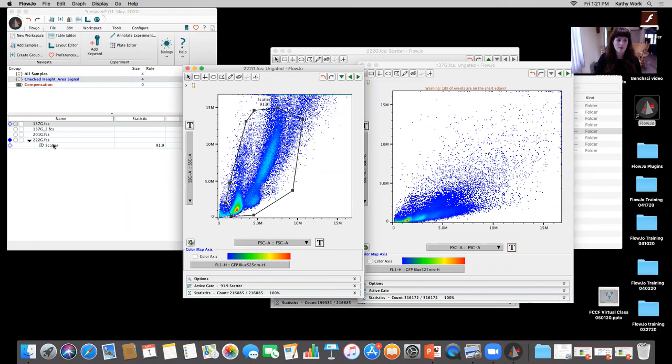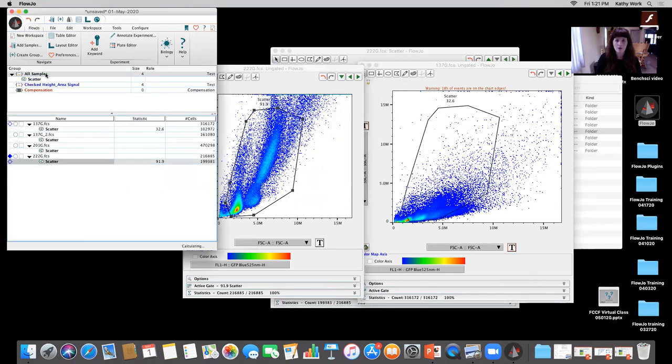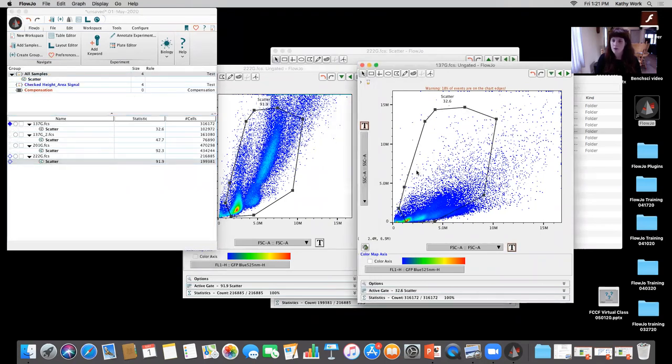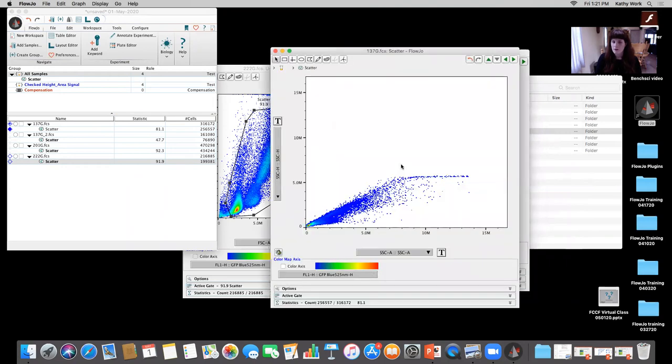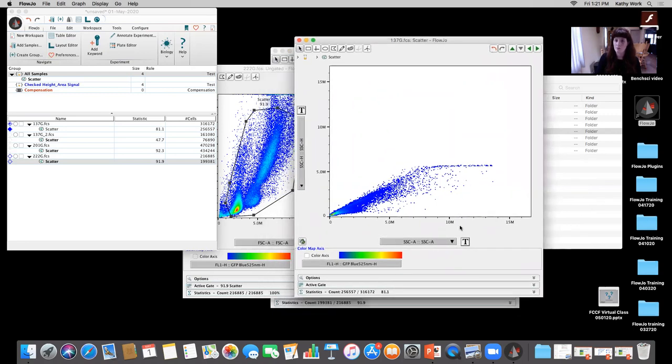16,777,000. If I just drag this scatter gate up to all samples, and I'm a little bit more open there on the gating, to try and include a similar number of cells as close as I can get, when I double click there, I can now much more accurately determine where my single cells are. And you can also zoom in a bit to get a better visual inspection of where those cells lie, so you can draw a bit of a better gate.